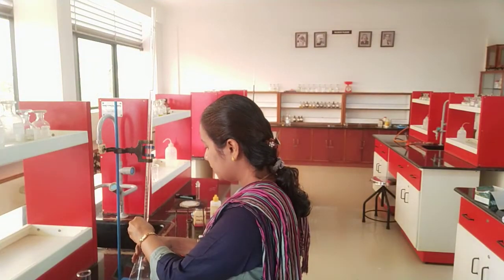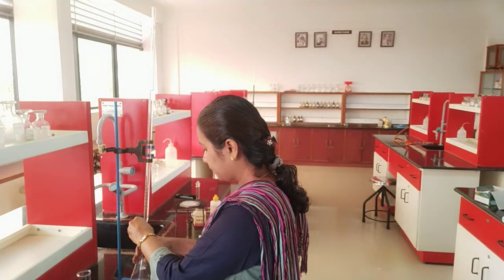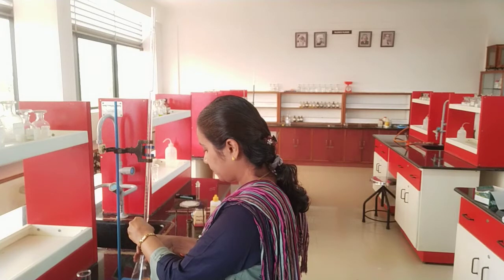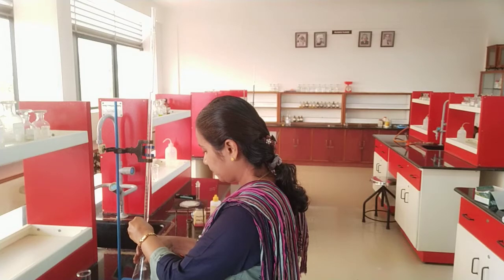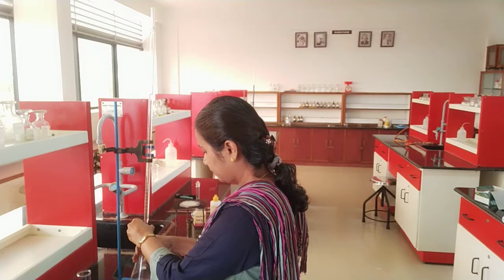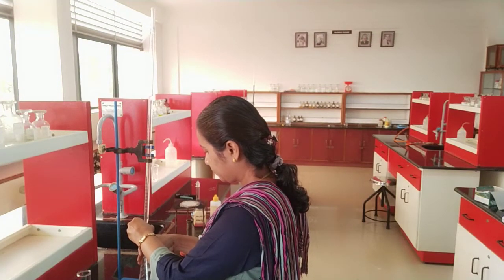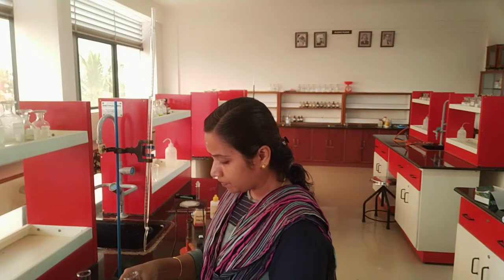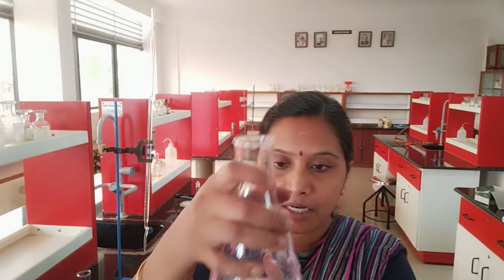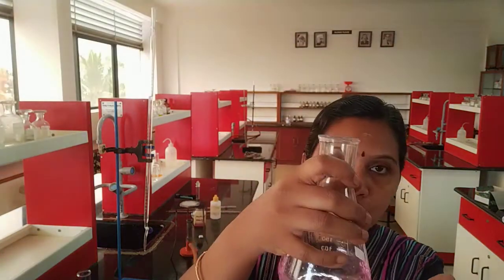I am seeing here and proceeding with my reading — it went up to 15. So I just want to show you the end point. Children, can you see the end point? The end point is the appearance of permanent pink colour.